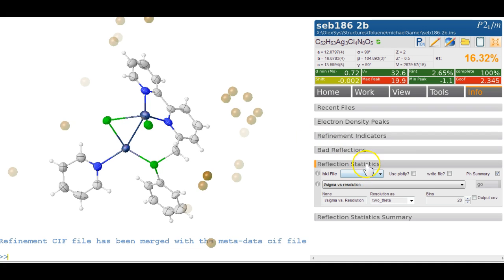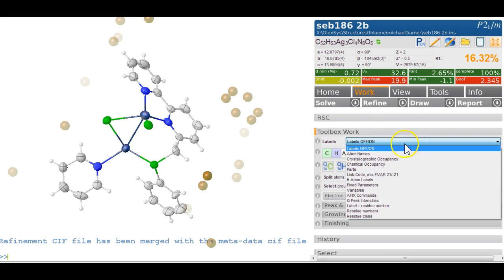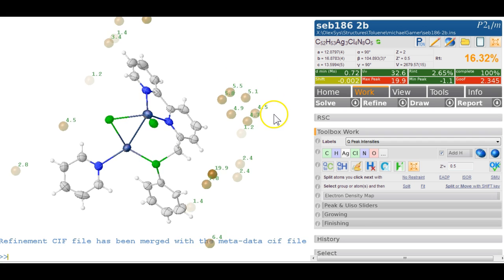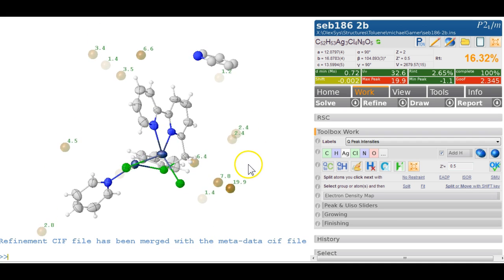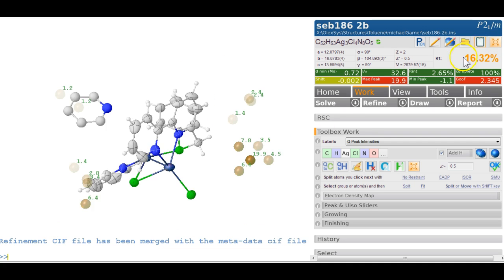Nothing is grown, so let's deal with that first. We can go into work and look at the Q peak intensities. 5, 5, 5, they're all roughly the same. 5.5, 5.8, so let's just make this the nitrogen, name N, and then make the rest the carbons. Use the up key and just replace the last letter. Okay, what else have we got in here? There's the big one. So it's probably a perchlorate. So there's something that needs to be grown or put together, and there we go.